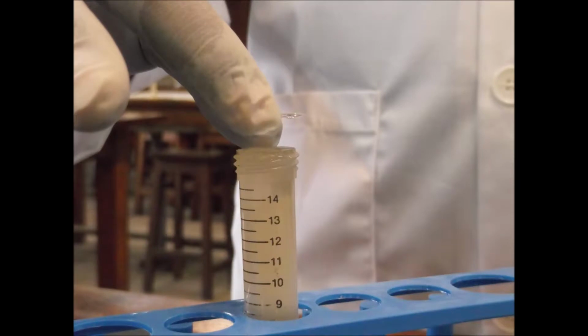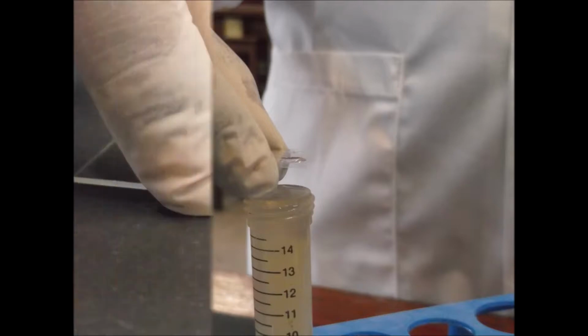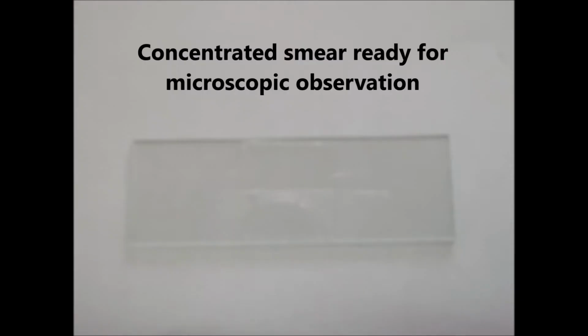After 30 to 45 minutes, gently raise the cover slip with a direct upward lift. You must take care not to spill any liquid. Place the cover slip on a clean slide with the wet side of the cover slip placed down. Now the preparation is ready for microscopic observation.